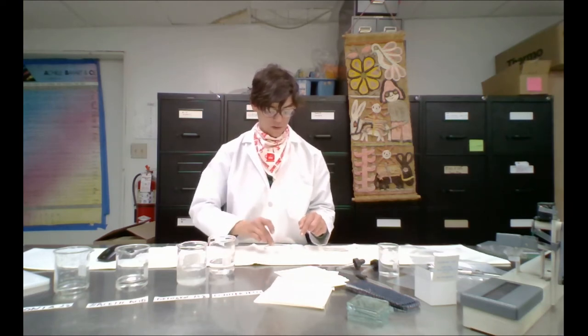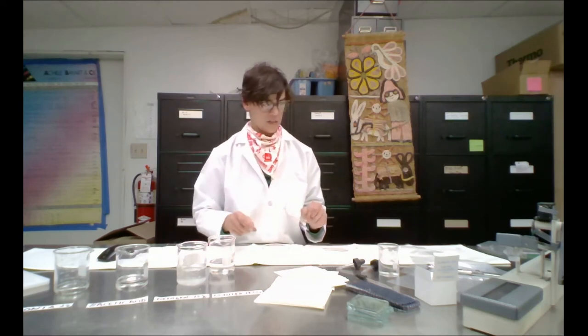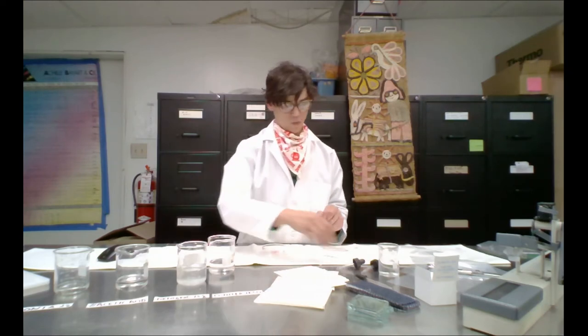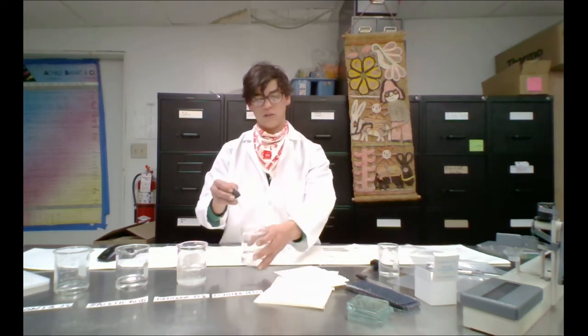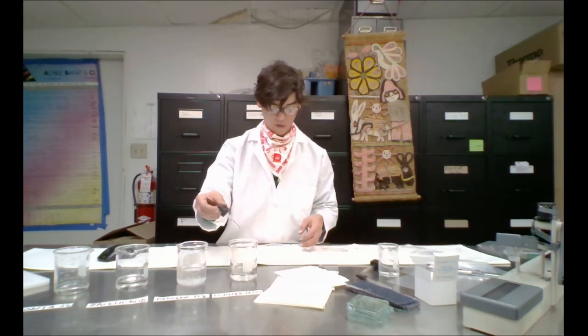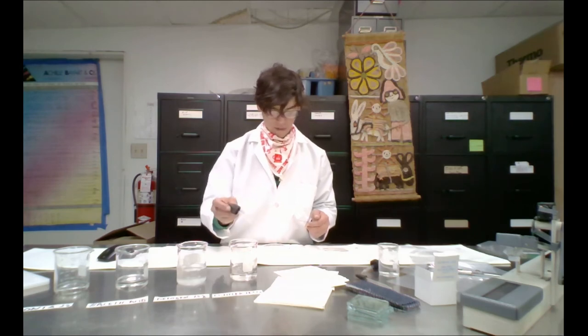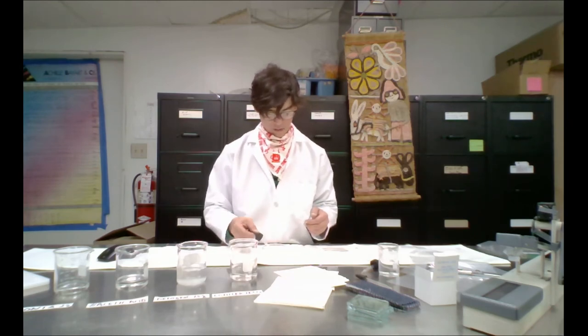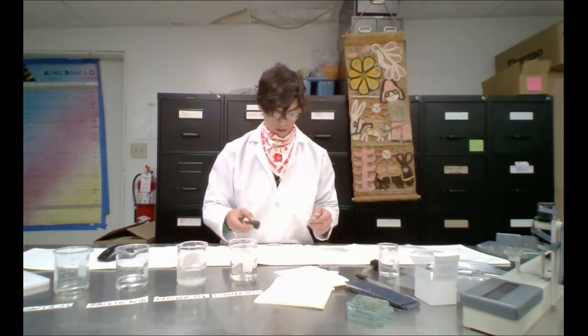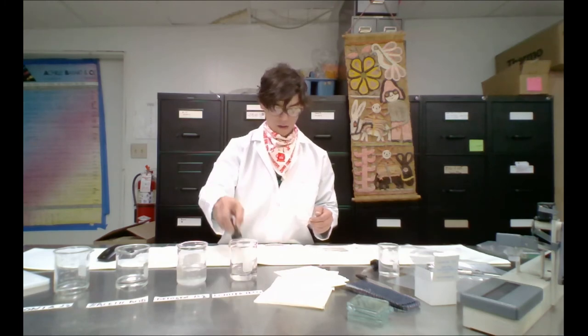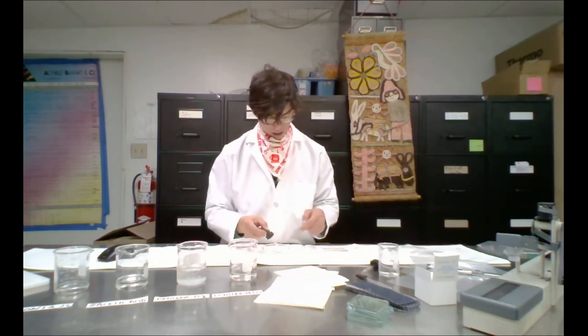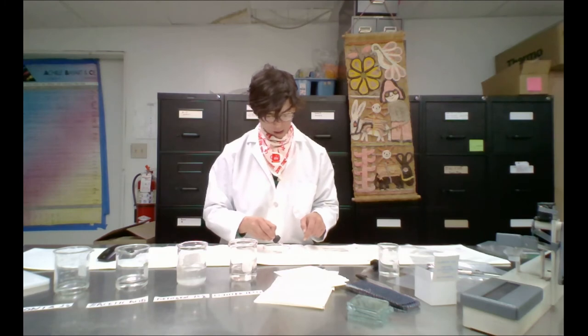So I'm going to completely wet out the yarn samples I've taken with the pipette and our weakest solution, the distilled water. And we're going to see if it starts to bleed. I'm not seeing any color loss.